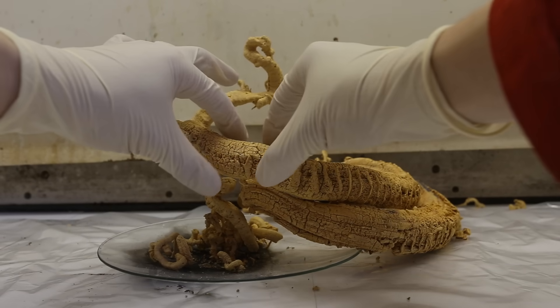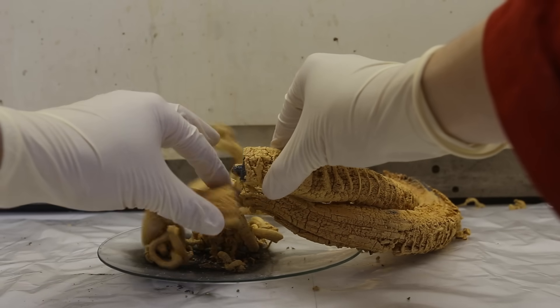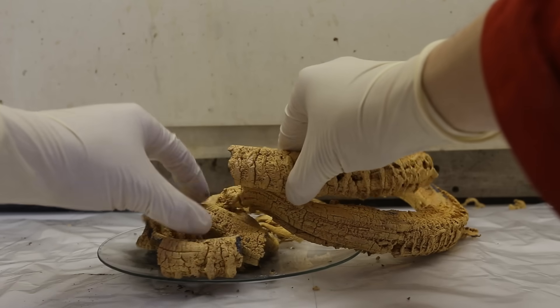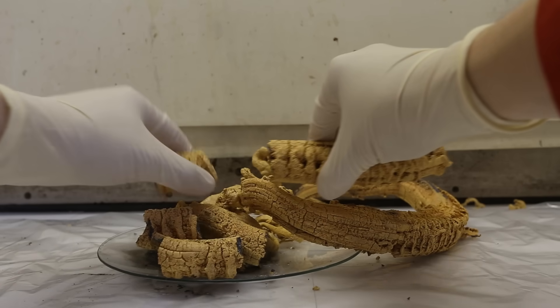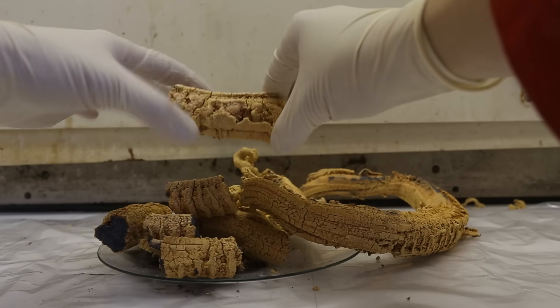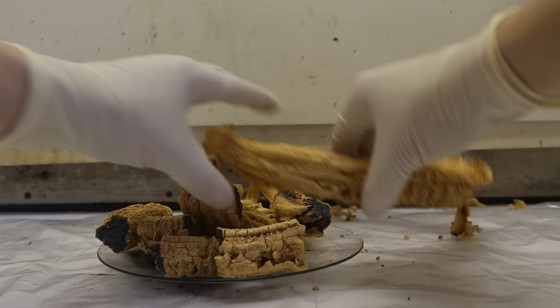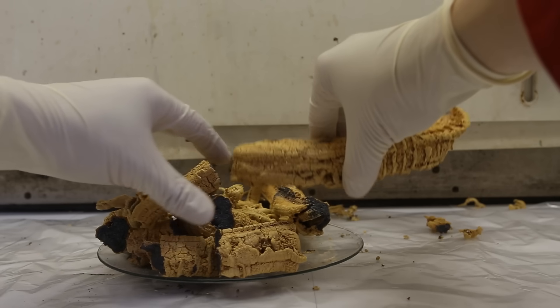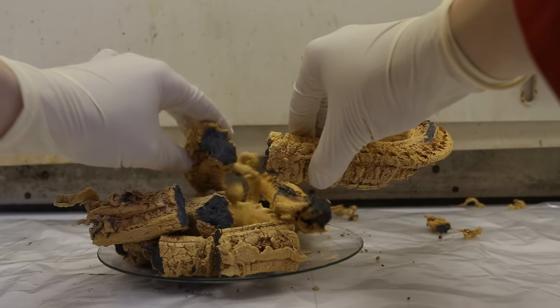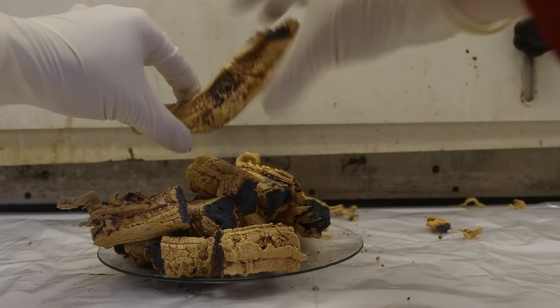This is just a demonstration to show how fragile and brittle the resulting ash is. The snake is made up of almost entirely carbon nitride, which is quite spongy and contains a lot of the gases produced in the reaction inside of it. When the snake is broken apart to clean it up, be aware that gases will be released. The snake is highly contaminated with mercury, so clean up every piece you can find and place all of the bits in an appropriate mercury waste container.